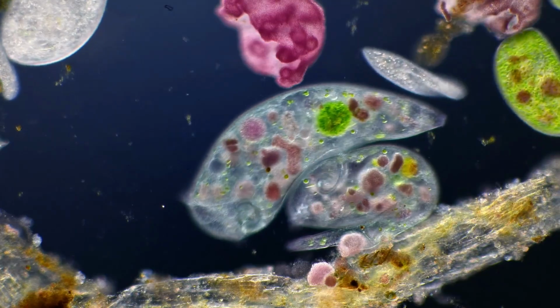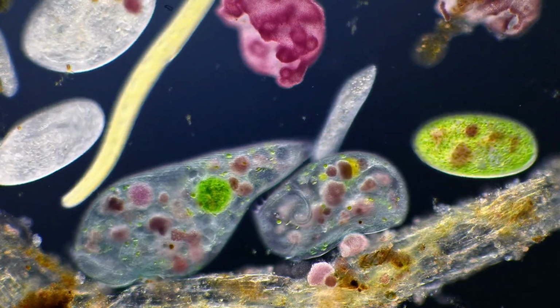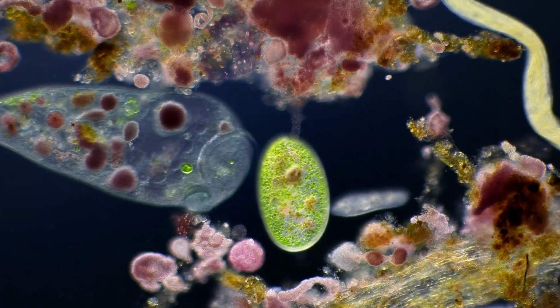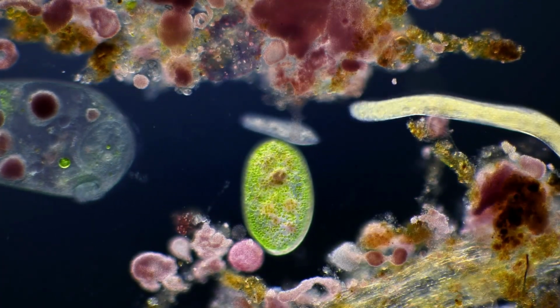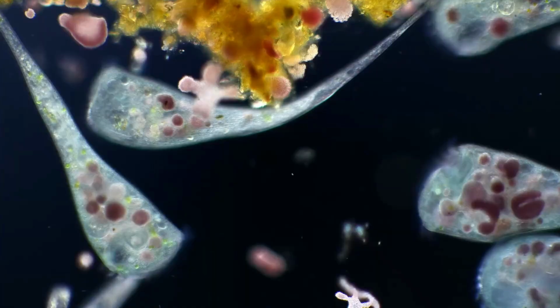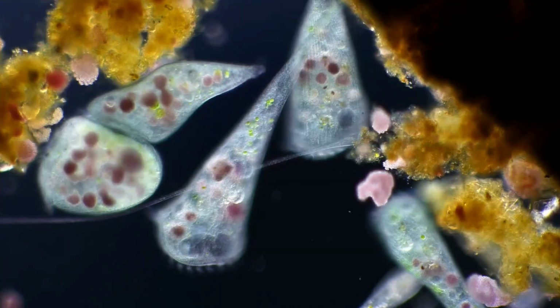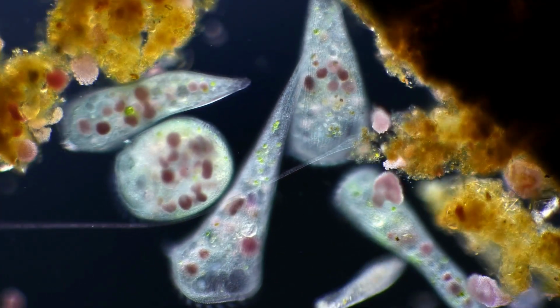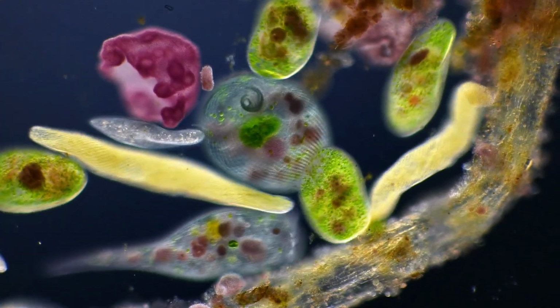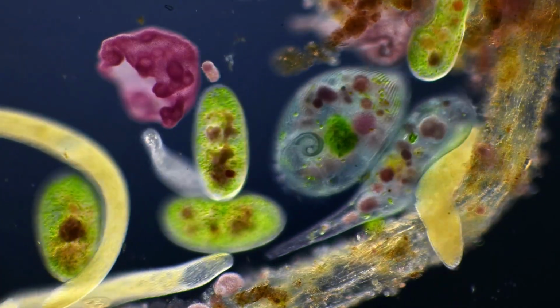These two large bluish cells are called stentors, and they are some of the biggest single-celled organisms on the planet. They move and feed using tiny beating hair-like projections called cilia. The cilia create a flow of water and food particles towards the front end of the cell where it can be ingested. Inside each cell we can clearly see the different ingested materials, where it is currently being digested. Stentors are also known as trumpet animalcules, due to their trumpet shape when stretched.